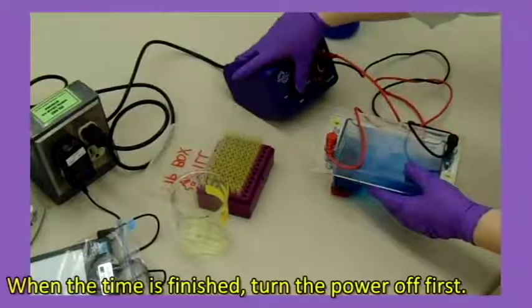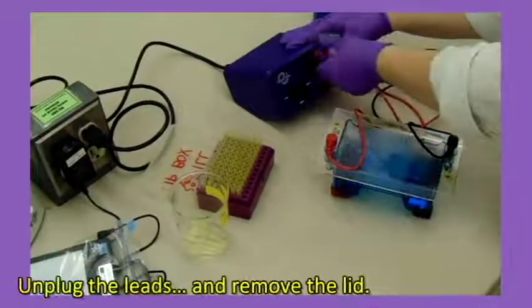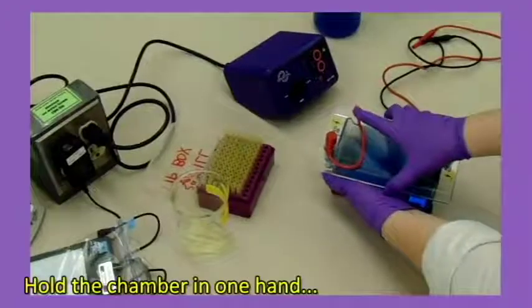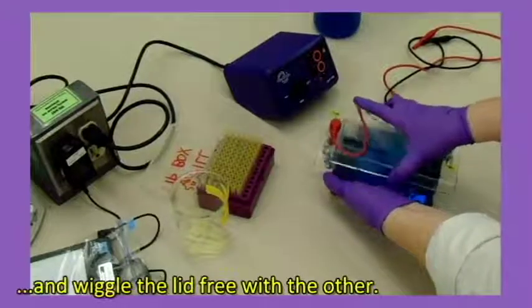When the time is finished, turn the power off first, unplug the leads and remove the lid. Hold the chamber in one hand and wiggle the lid free with the other.